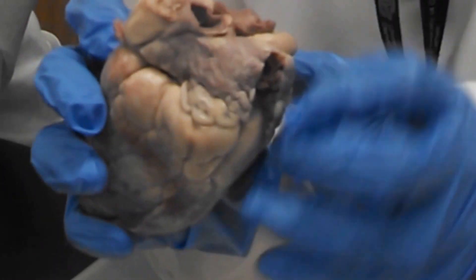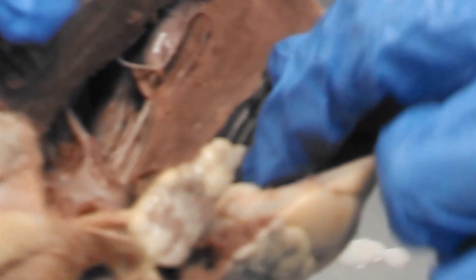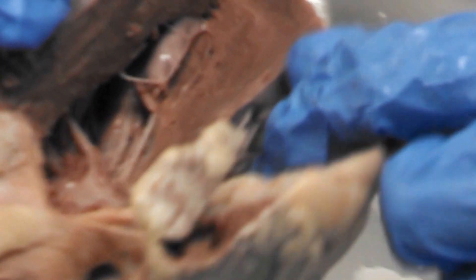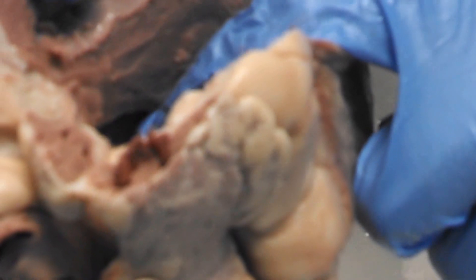On the top of the heart, if we were to open this heart up, we can see the right ventricle and left ventricle down here. We have the chordae tendinae, and we have the bicuspid valve dividing the left atrium and left ventricle.